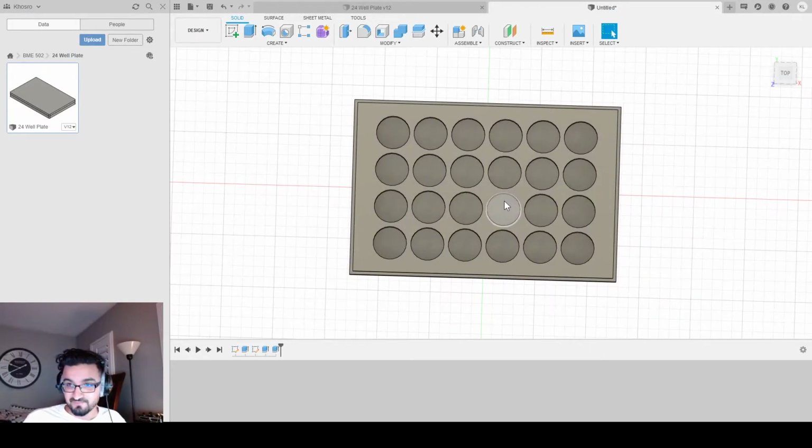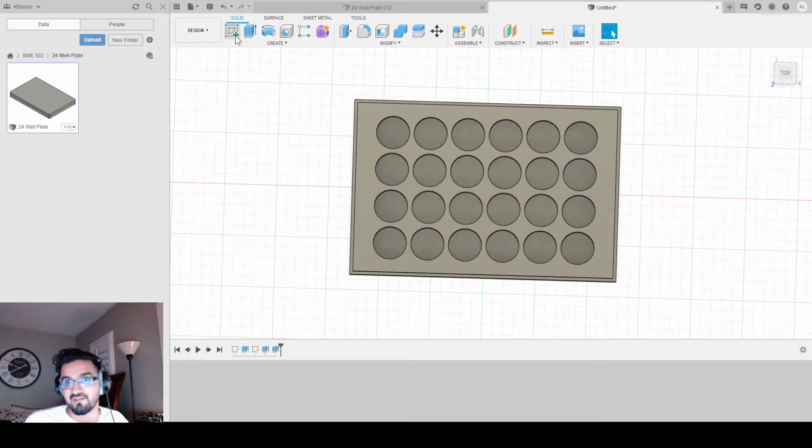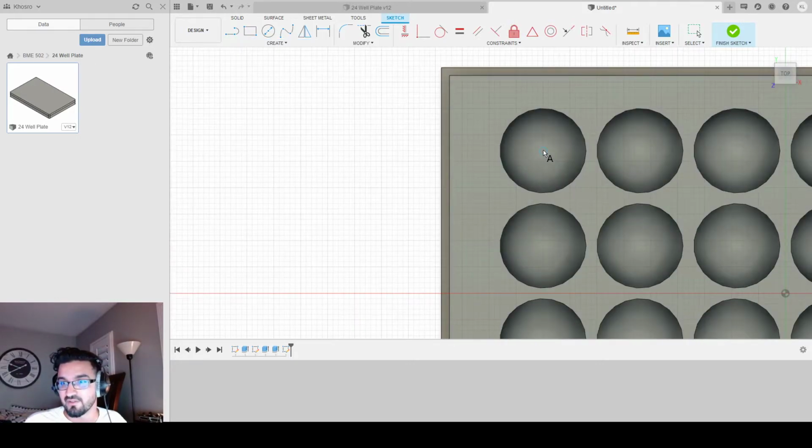We still got to do the numbering here, right? So we got to determine what our rows are and what our columns are, correct? So let us go back into sketch mode. Select this surface. We're going to go create text. And we're literally going to go to where it lines up at this origin. So see, it kind of snaps in to this origin point, and there's a circle, right? Now all I got to do is drag my mouse to the left, and it'll tell me, okay, you're still at the origin here. And I could kind of eyeball it. This is where I want the text to start.